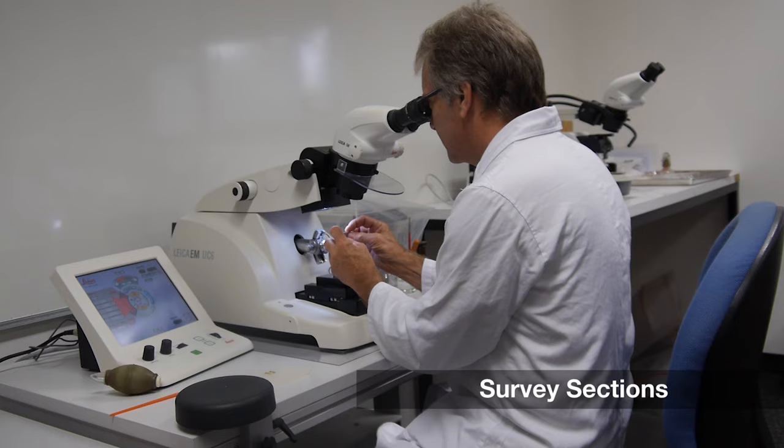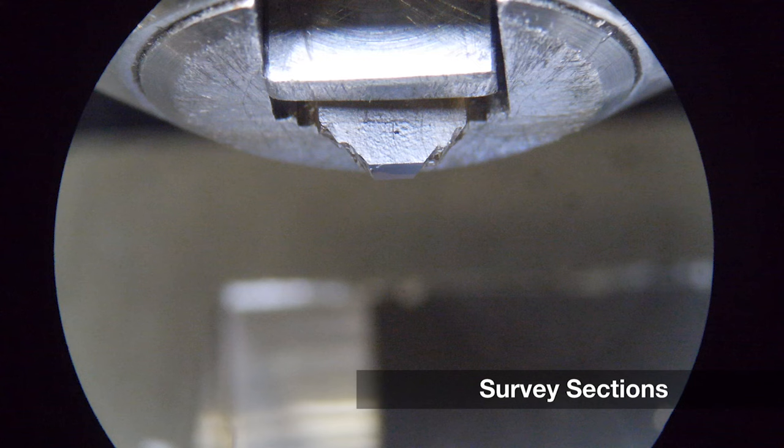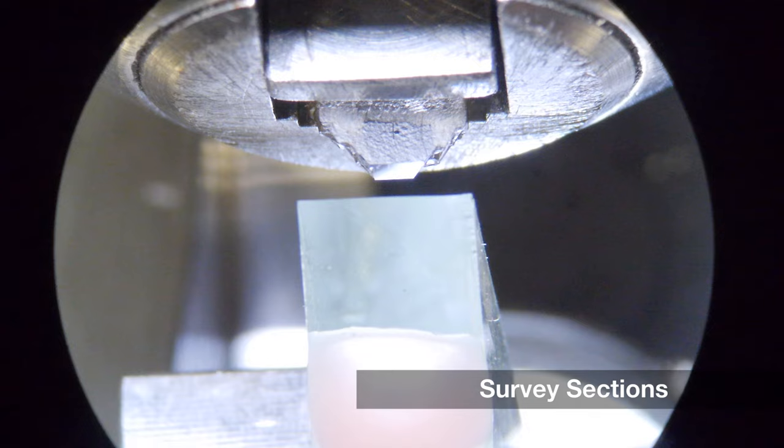Final trimming is done using the precision controls of the ultramicrotome and a glass knife. When the full cutting face is exposed, a new knife is inserted into the ultramicrotome.